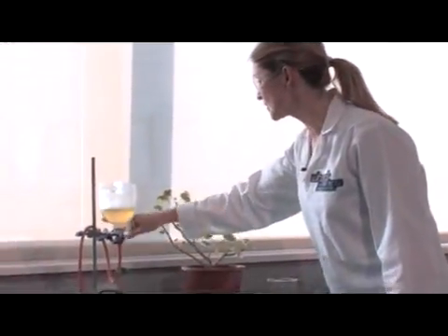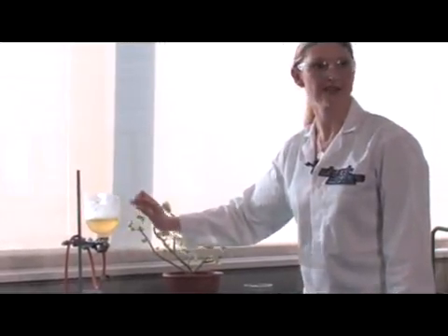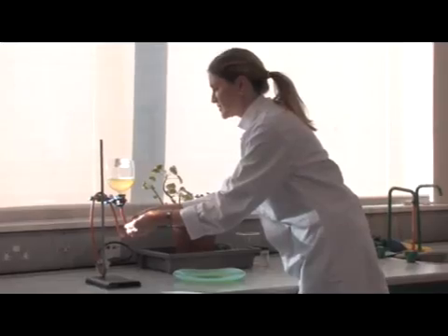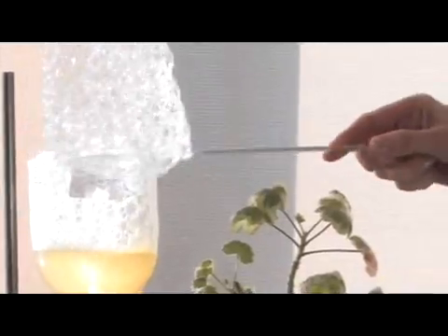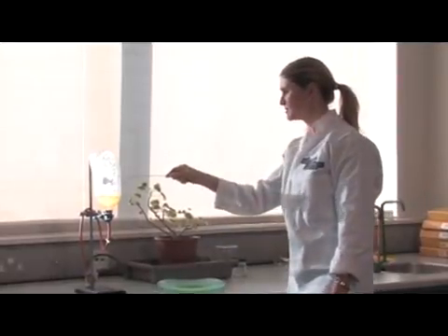For Flaming Hands, I need to put some gas through this tube here and into some bubble mixture. The gas I'm using is the gas that comes out of the taps in your science labs, and I'm going to bubble some of this methane gas through a special soap solution. Now the first few bubbles will contain air from the tube, and the next lot of bubbles contain methane. I'm going to turn that off.